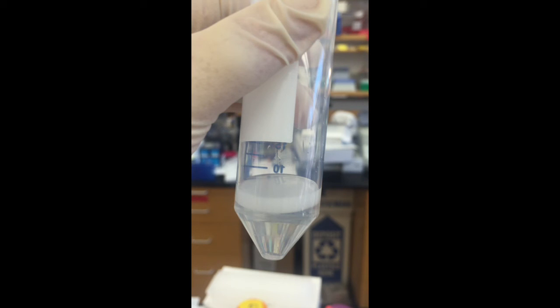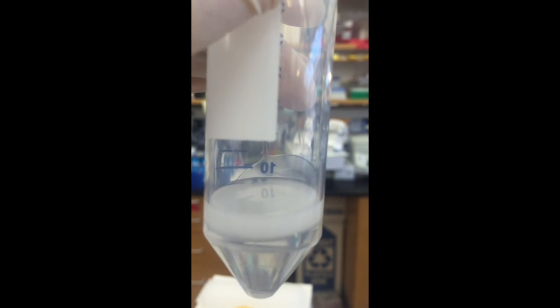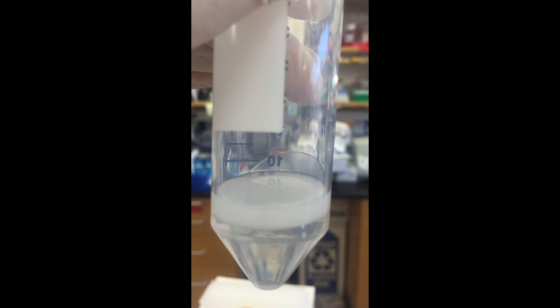You can check it quickly partway through the run once you've accumulated enough droplets in your falcon tube to do this with. You can just lift it up slightly while the run is still going, gently rock it to the side so that you can watch the droplets run down. And it's just a nicer way to visualize how successful your droplet generation is going.